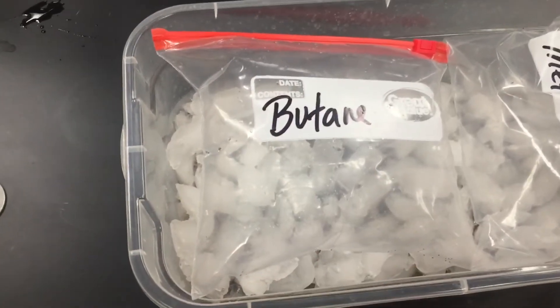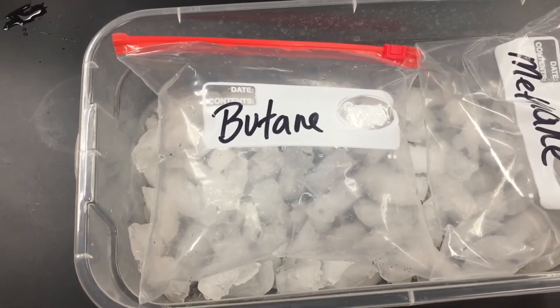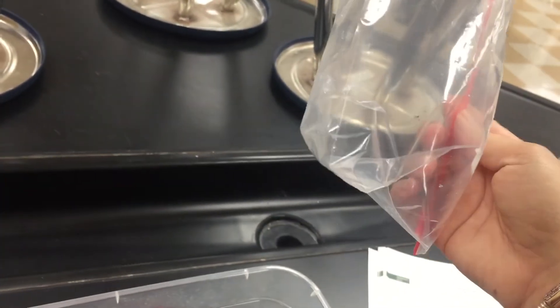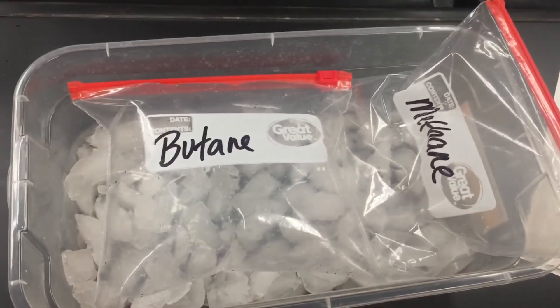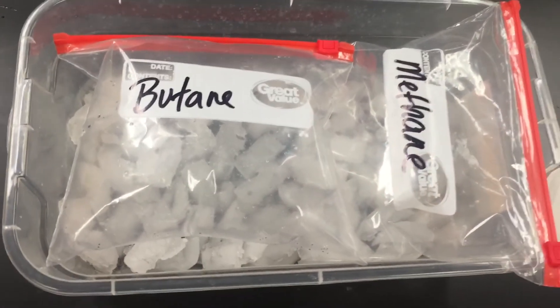What's happening to the butane as temperature decreases? Nothing is happening inside the methane bag. Inside the butane bag, you can see a lot of condensation. I'll leave it here for a while and then take a picture of its final product.